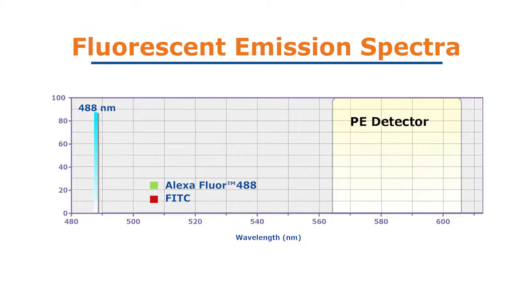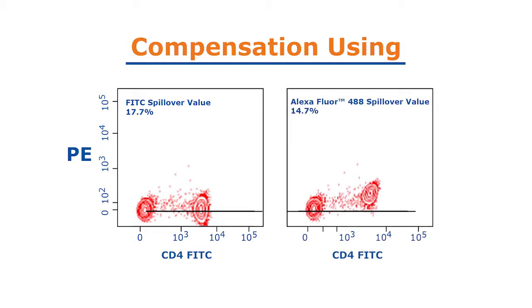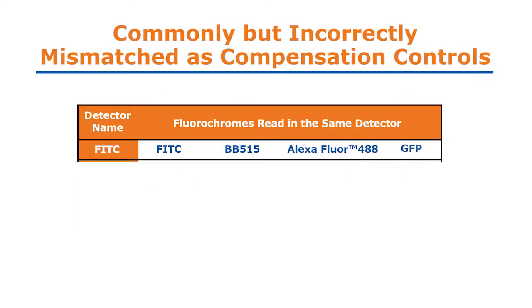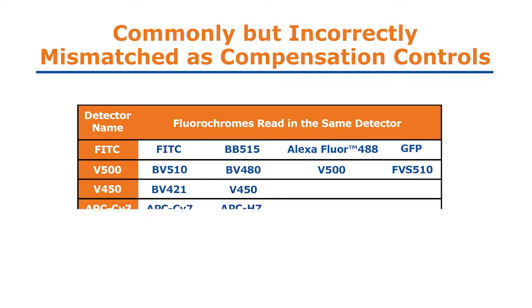Even similar fluorochromes such as FITC and Alexa 488, seen here, have slightly different emission spectra, which leads to different spillover values. As shown in this example, this means that FITC spillover values are appropriate for the FITC dye, while using the Alexa Fluor 488 spillover values will lead to undercompensation for that same reagent. Here are some other dyes that are read in the same detector and are commonly but incorrectly mismatched as compensation controls.